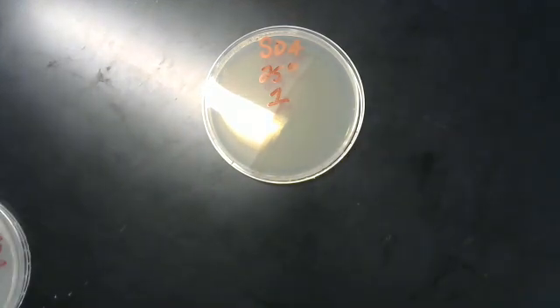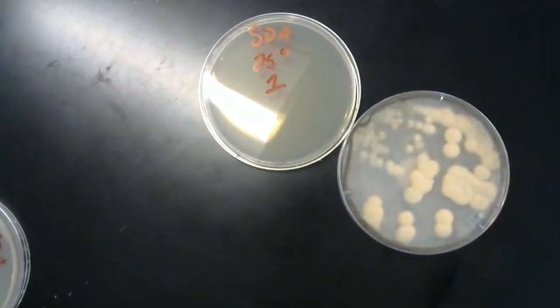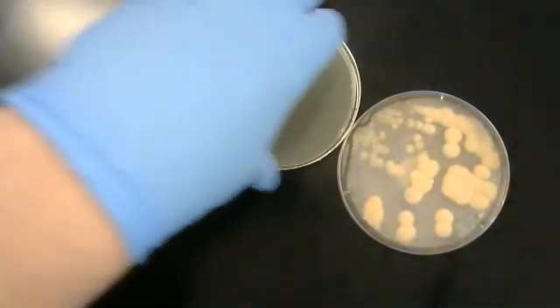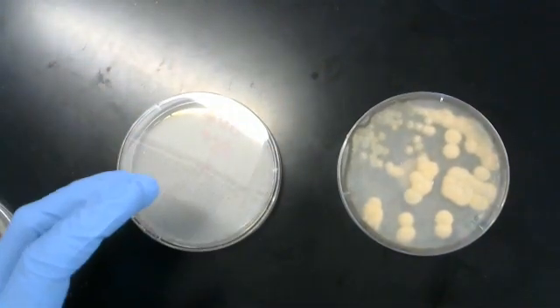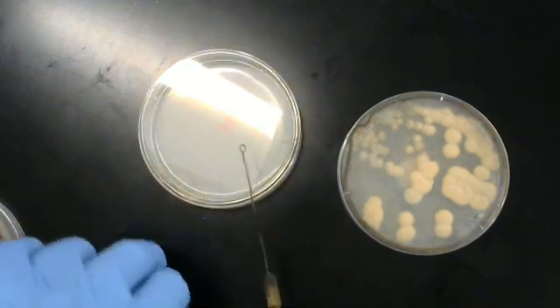Let's start with number one, and we're going to start with this bad boy right here. Now if you take a look, how we're going to do this is we are going to take some of the agar from here and place it in the center of this plate here.